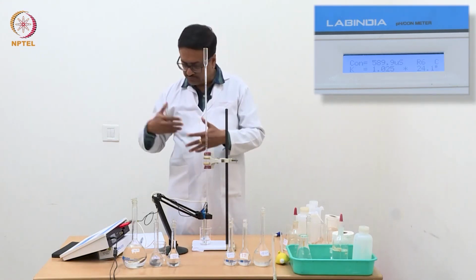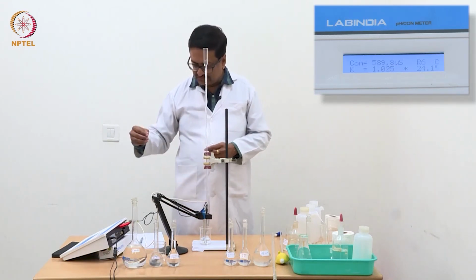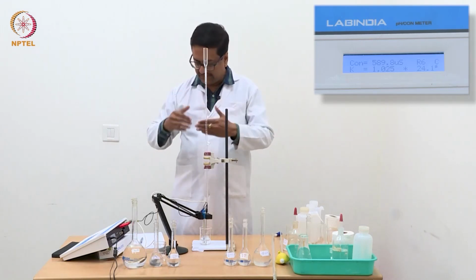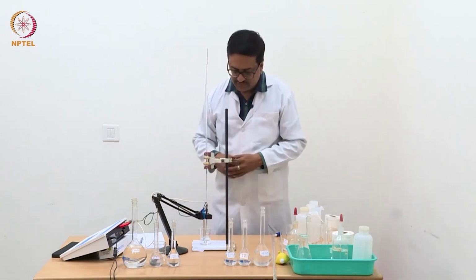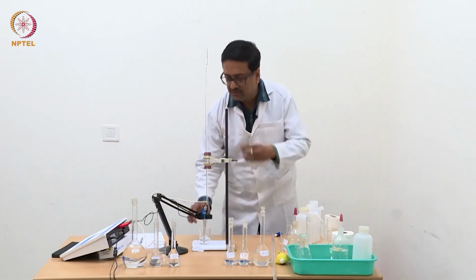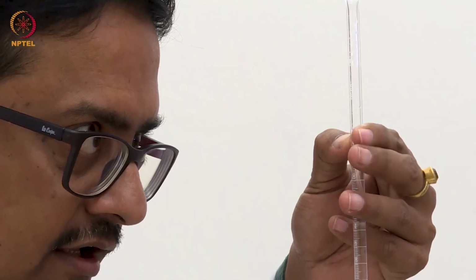So about 30 to 40 microsiemens difference is coming even now, with 629, 630 becoming 590. So that gap of conductance between the readings is maintained like about 40 microsiemens, which means that we are still constantly decreasing the conductance, because still we are having HCl in solution.